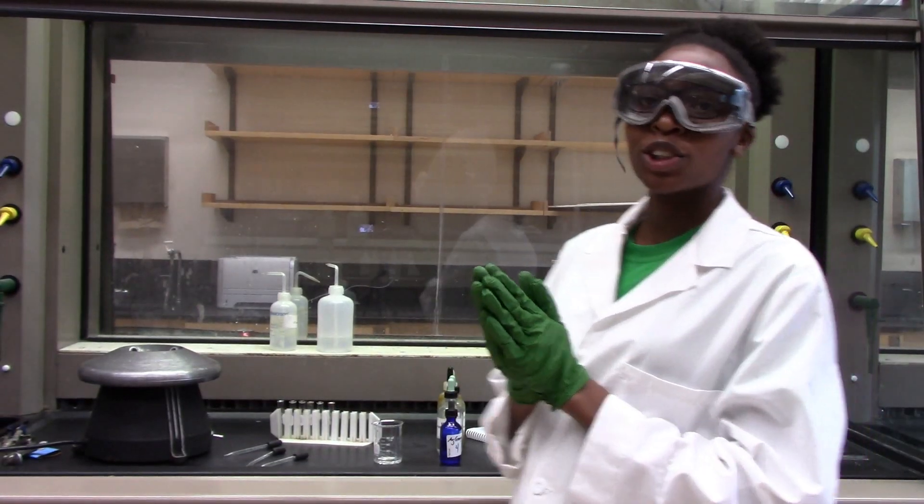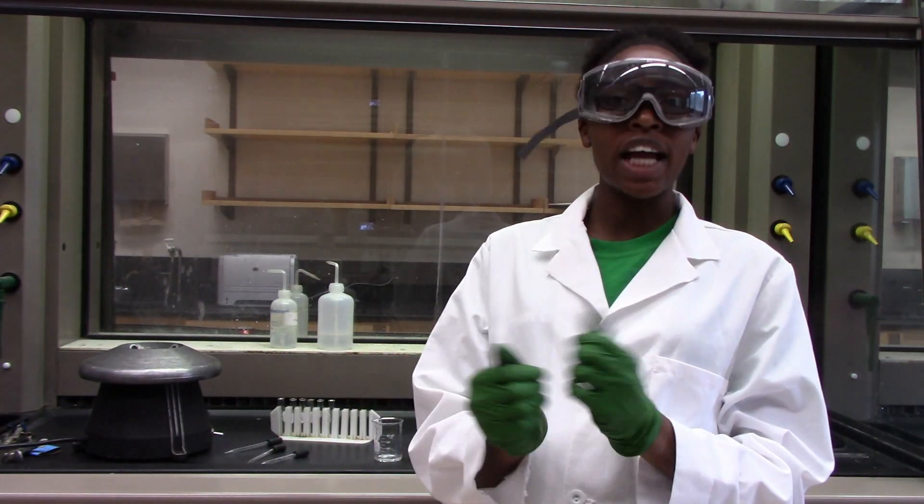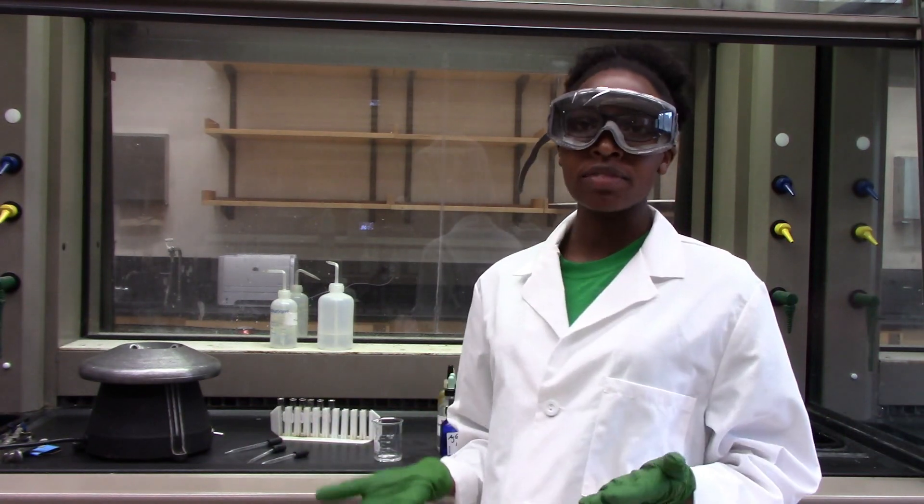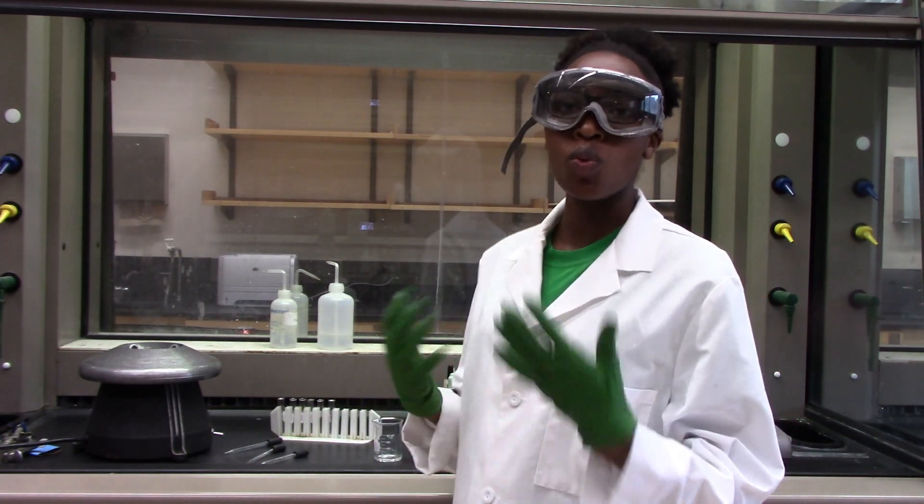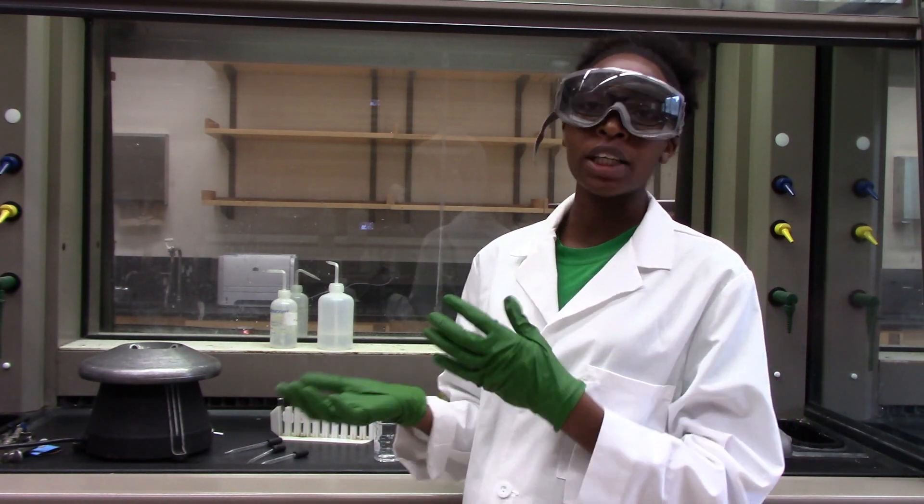Hey guys, so today we are doing an experiment on qualitative analysis of the silver group cations. Qualitative analysis is when you answer the question what is in something and quantitative is like how much of it is there.